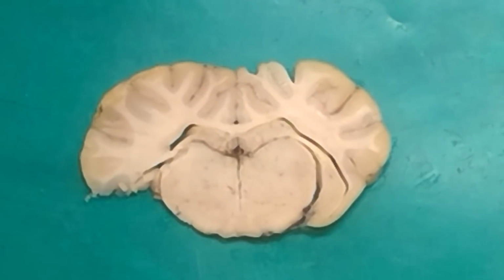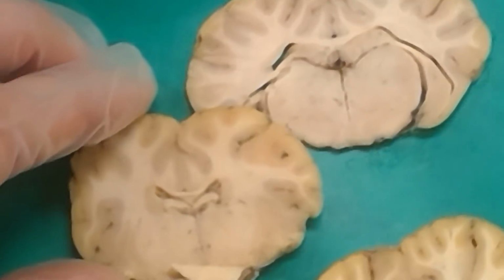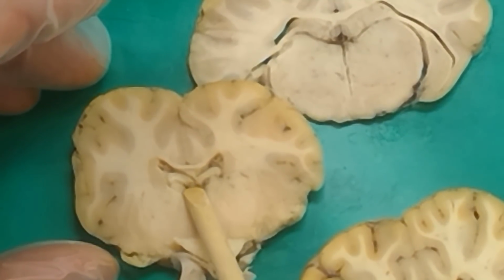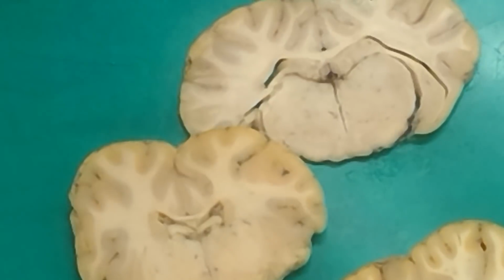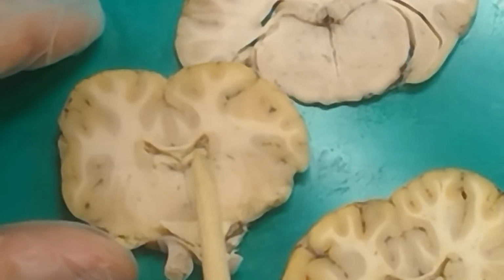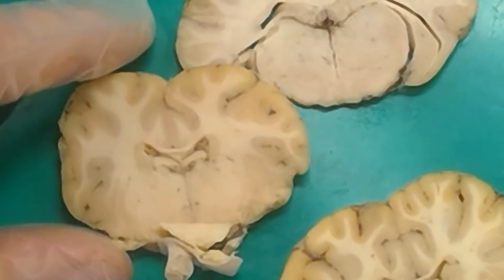So you can start seeing the thalamus when you can see the fornix. The fornix starts showing up around the very beginning of the thalamus. But yeah, when you can see the third ventricle also. So like this guy right here, I can see fornix here. I can also see third ventricle because it's kind of that fornix that's creating the third ventricle by going up around the front part of the thalamus. It's creating that separation between the lateral ventricle above it and the space then below it, which is the third ventricle.